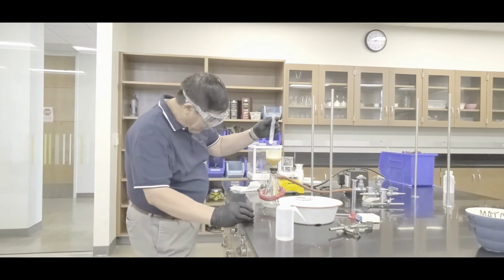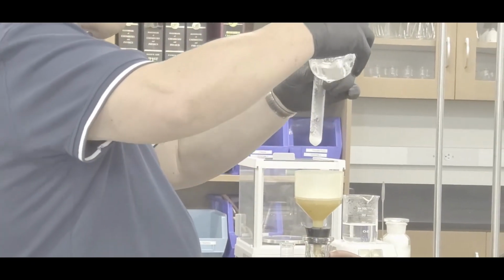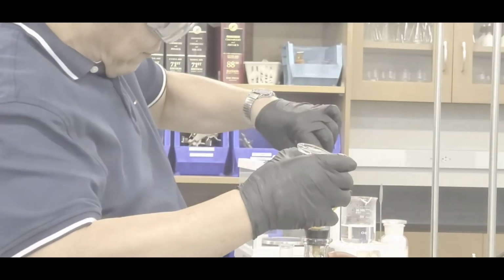Yeah! And what happened is this, the white powder's right there, and then you've got the clear liquid. So in that case, just do a few more times until you get it all, okay? Like that.